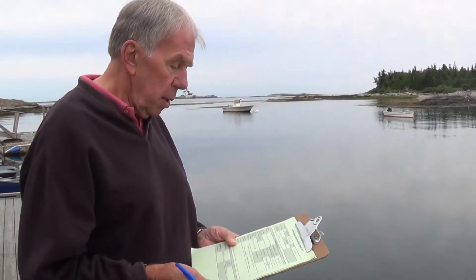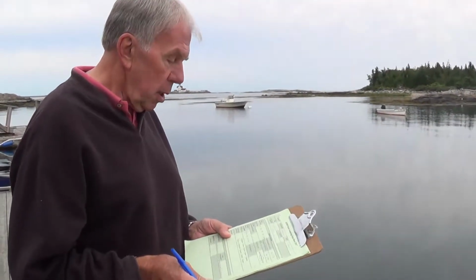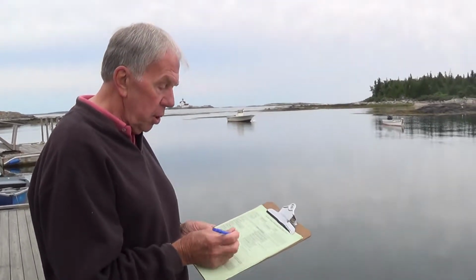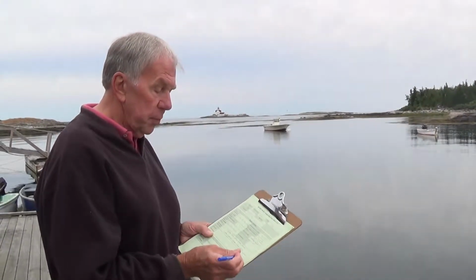It asks you, these are somewhat qualitative, but observations of the nature of the water. Things like, are there jellyfish present? Is there a lot of seaweed present? Do you notice other forms of life? We had some ducks floating around here, paddling around rather, a few minutes ago. So you want to annotate it. For this observation, there's no jellyfish. I've seen no fish, but there have been birds.